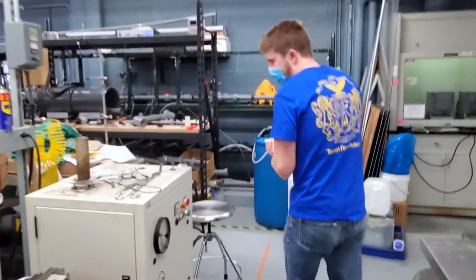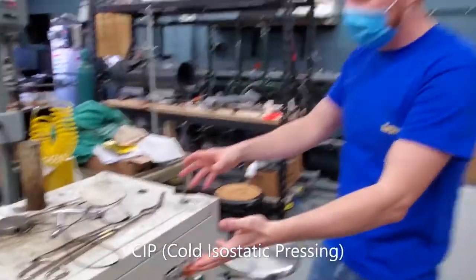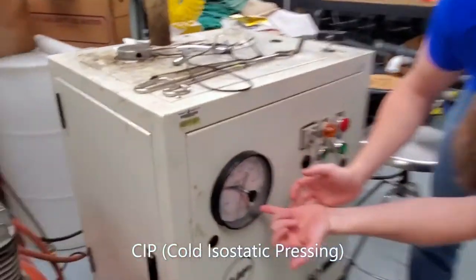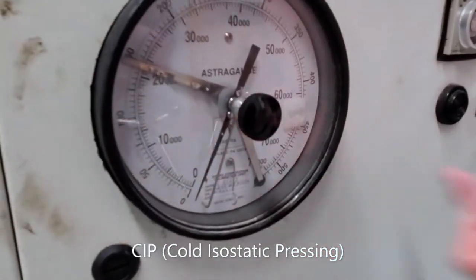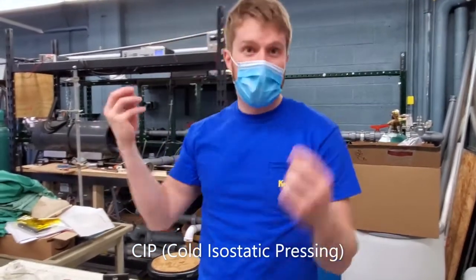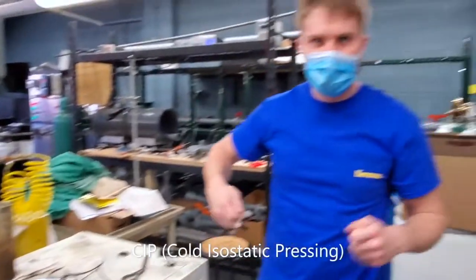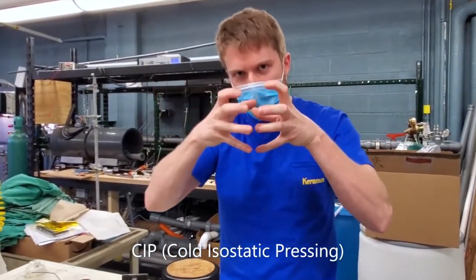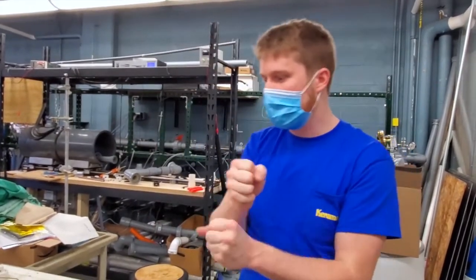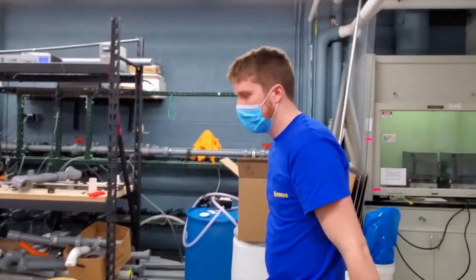The next thing is a press that uses extremely high pressure. You can see on this gauge here, we go up to 70,000 psi if we need. You take ceramic powders or powders of different things and put them in here, and then you crank up the pressure, and that compresses them together and forms what's called a green body, which is a highly compressed version that hasn't been sintered and atomically bonded yet.